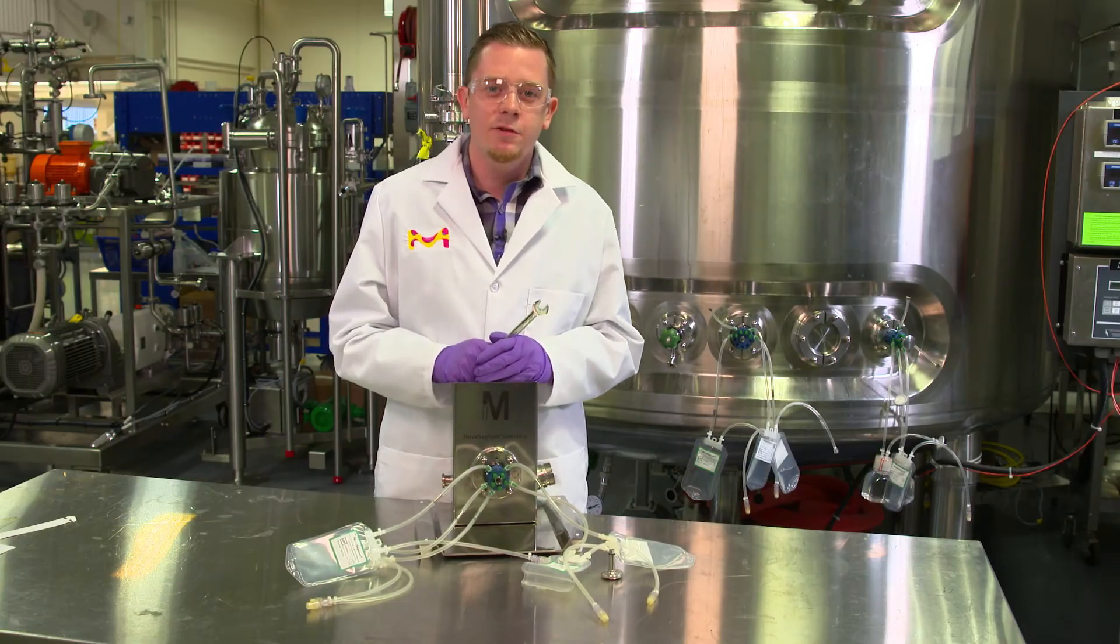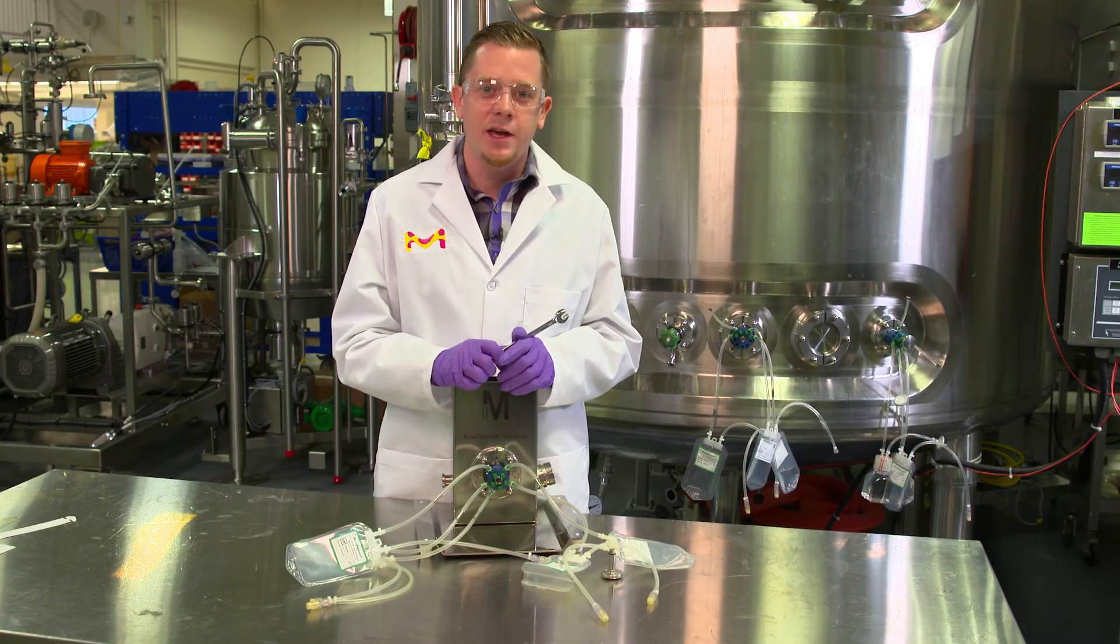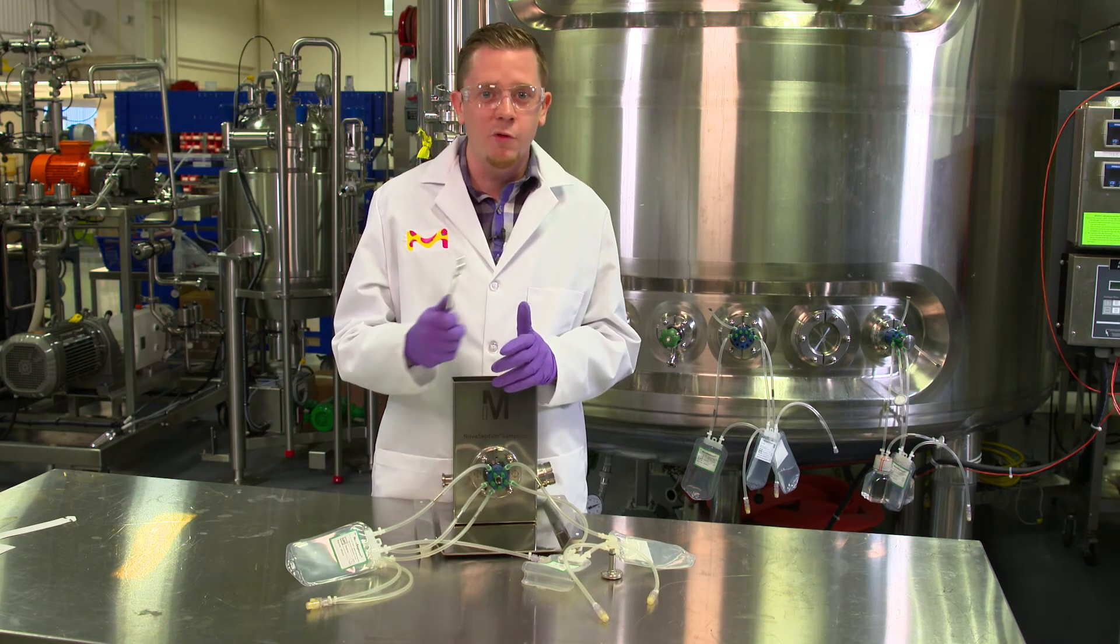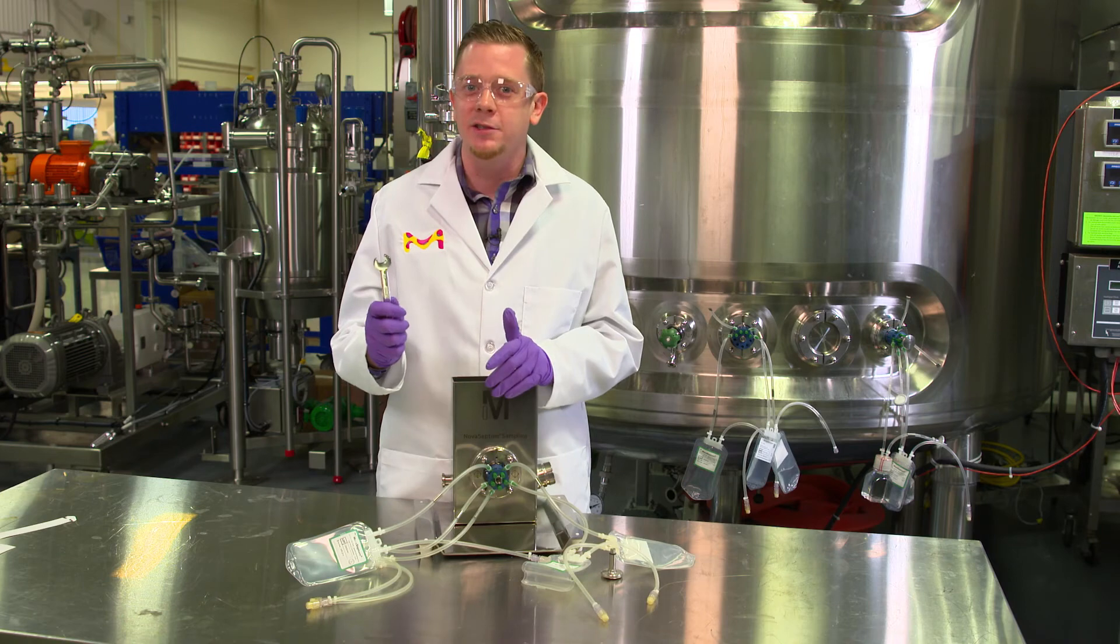So once everything is tightened down, we're ready to steam the inside of our tank and sterilize everything. We can now begin sampling, removing the sample containers, and analyzing the sample.